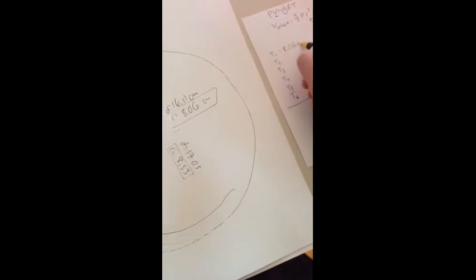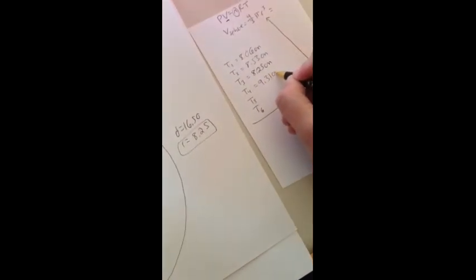So let's look at our different, these T's represent trial, the different radius measurements that we found. So 8.06 was 1 centimeters. 8.53. If we notice that they're all fairly close to one another, that's a good thing. It means our reproducibility was good. 8.25. We have 9.31. That's a bigger one. 9.46. You can see that's the balloon at its most elliptical shape. And then 8.07.